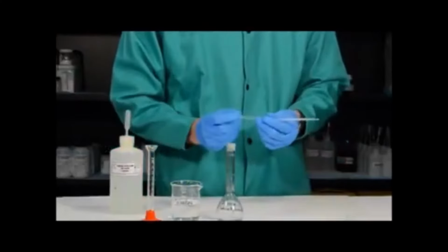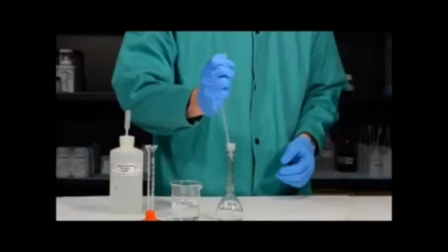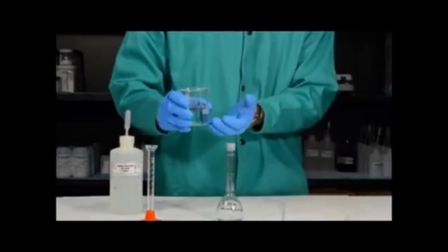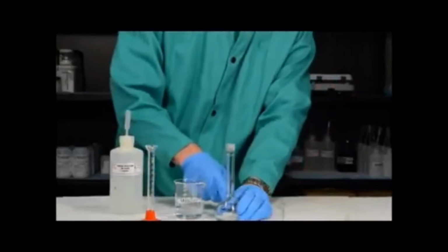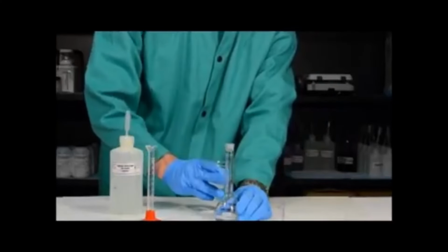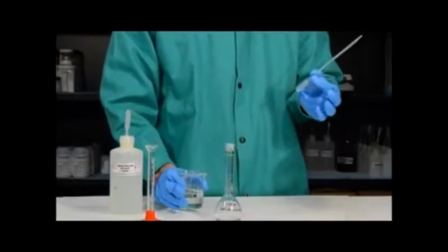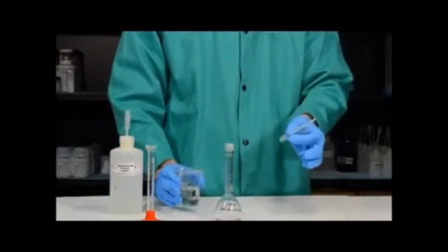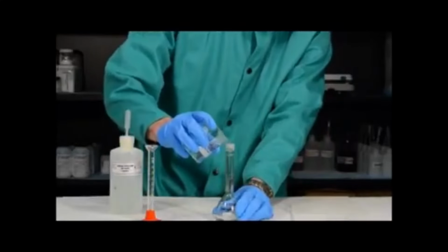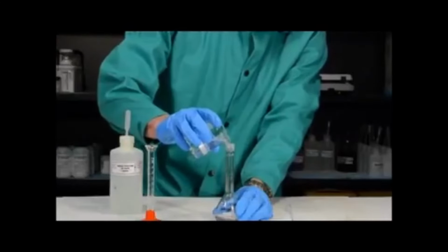If you're going to do this with a pipette, you'll notice very quickly that this will take you forever. You don't want to do it with a pipette. What you want to do is fill the flask up into the neck by pouring. Then once you're in the neck of the flask, but still below the calibration line, you want to use the pipette to get the exact amount of solution that you need. This is the most efficient way to do this. So in order to do this, I'm going to pour the water up into the neck of the flask.